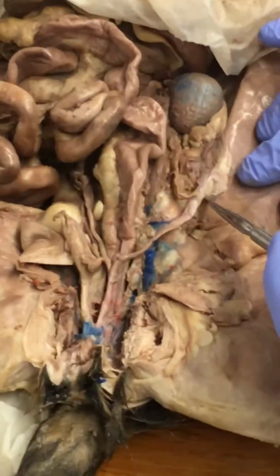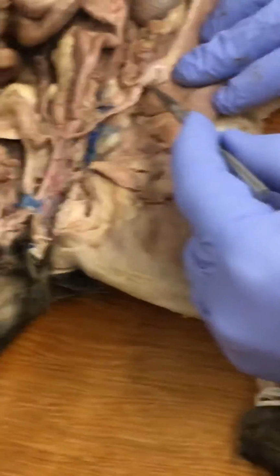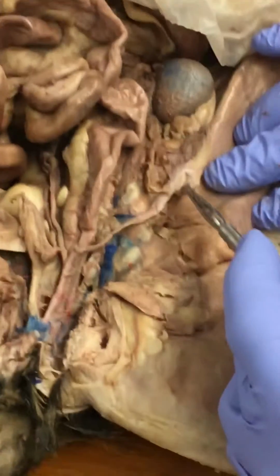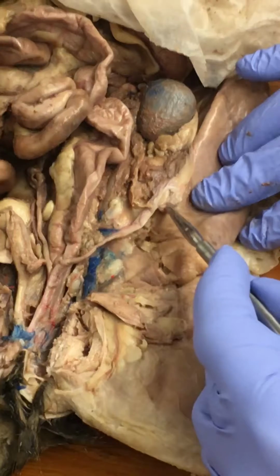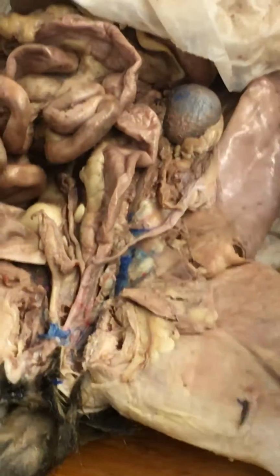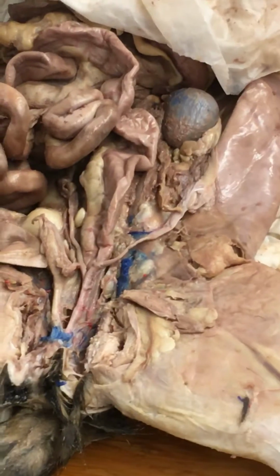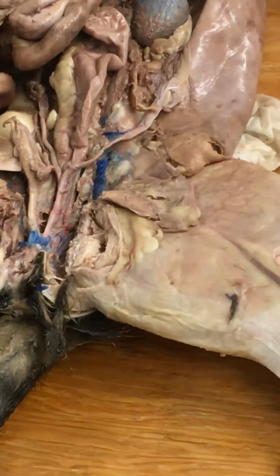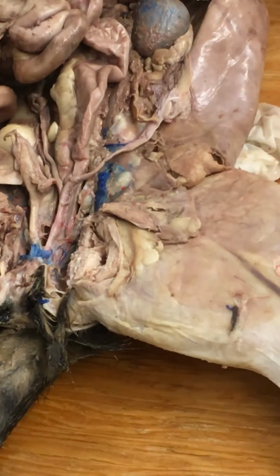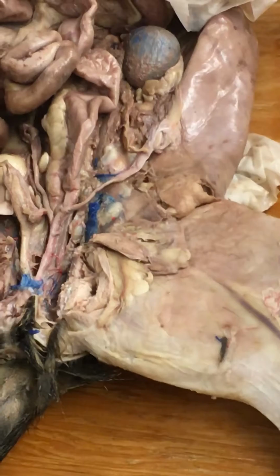You notice that in the back of this, in the cat, they're in a little pocket. This little pocket basically is where the fimbria are, for the oviduct, or the fallopian tube, that opens out to an ampulla like this. You'll see that in the human models a little bit more fully. And then it captures the ovulating egg as it comes out.